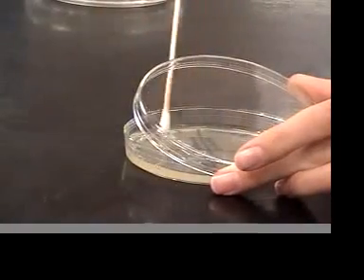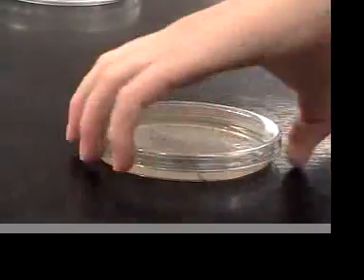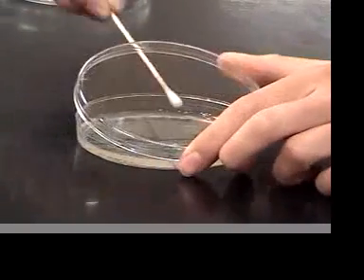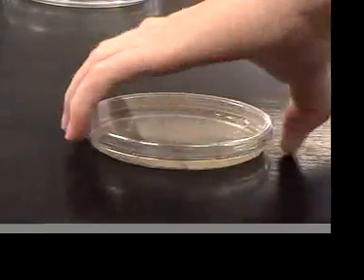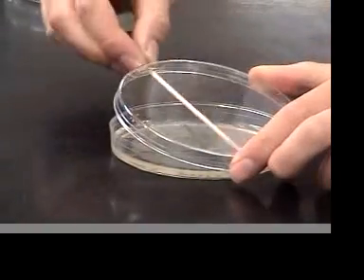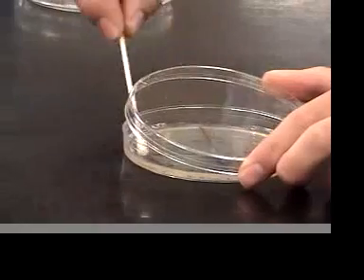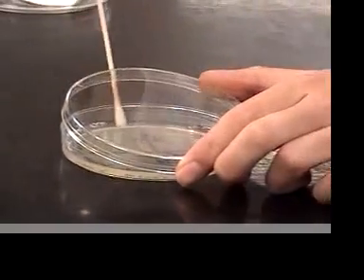You'll repeat this procedure for both of the organisms, Pseudomonas aeruginosa and Staphylococcus aureus. You'll also repeat this procedure for each of four disinfectants, so that we can test the effectiveness of both antiseptics and disinfectants against both organisms.